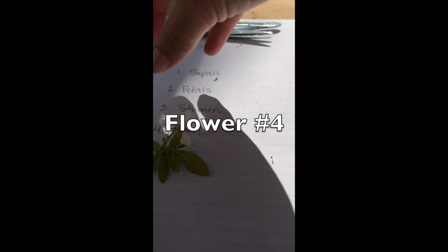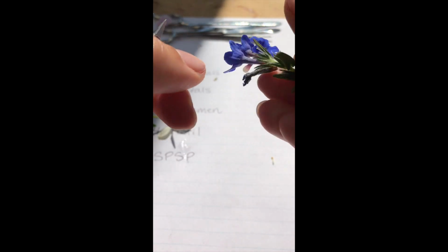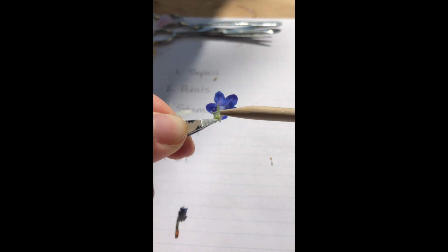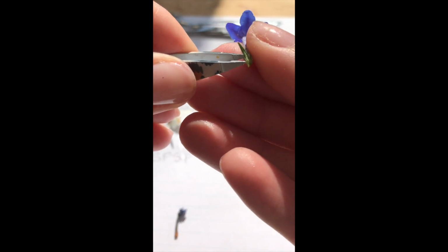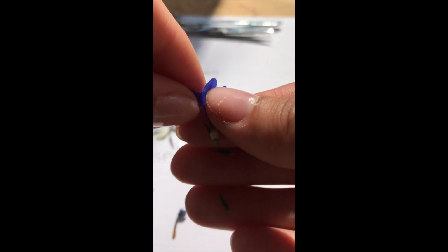Let's look at another one quickly. Here's an interesting flower. This flower actually has very, very long petals. So at first when you look at it, it almost looks like sort of a trumpet-like horn. But these little green guys at the bottom, that's the first layer, so we know that those have to be the sepals. And if we take off the sepals, the next thing we're left with, hopefully you thought in your head, petals.